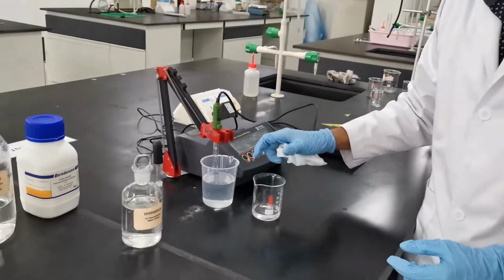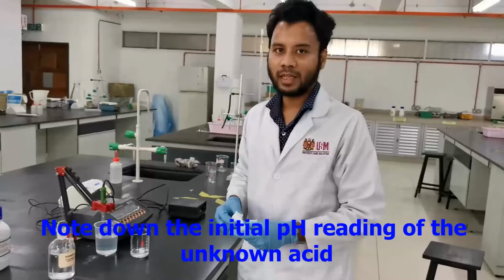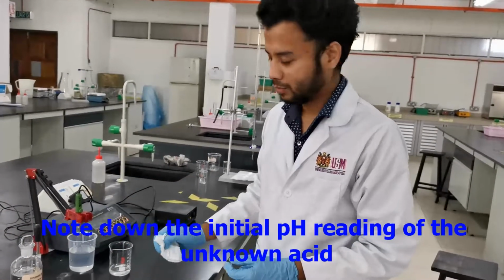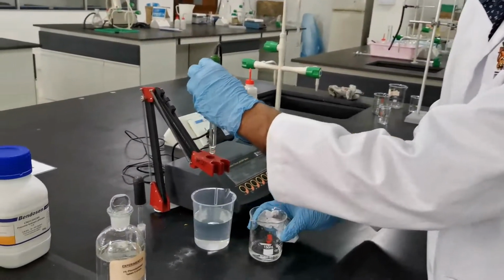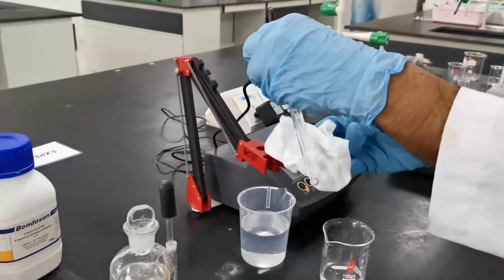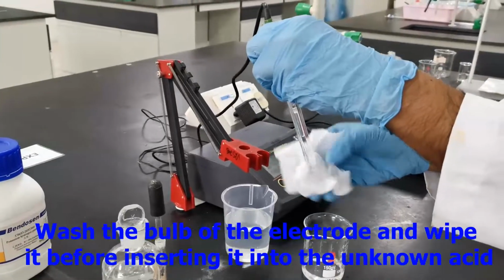Before you start, you need to get the initial pH of the solution of the unknown acid. So you get the electrode. Before you insert it into the unknown, make sure you wash the bulb of the electrode and make sure it is clean and dry.